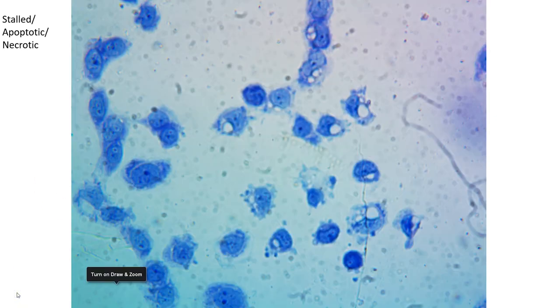In the last image, you had mostly stalled cells or cells undergoing autophagy. In this example, on the other hand, you have mostly stalled cells, or cells that are going through necrosis or apoptosis. You can tell that because here is a stalled but otherwise normal-ish looking cell, right? Otherwise typical looking cell. So here is a cell membrane. This actually has multinucleated cells, so there are multiple tiny nuclei within another membrane.